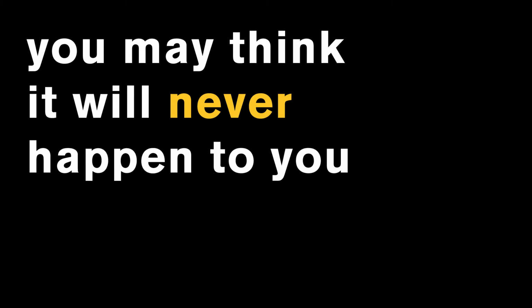Some of you may think this will never happen to you. Having this mindset leads to carelessness, which leads to injuries. Protect yourself from self-inflicted needle sticks by using the proper equipment and adhering to proper work procedures.